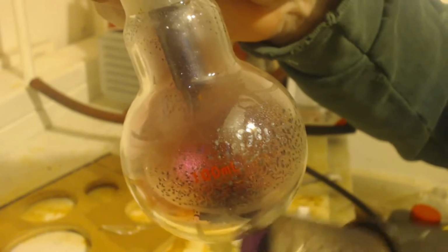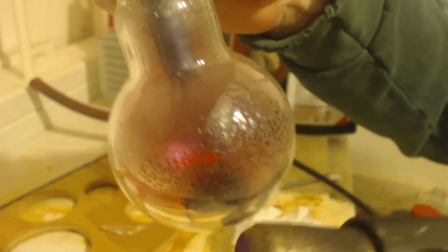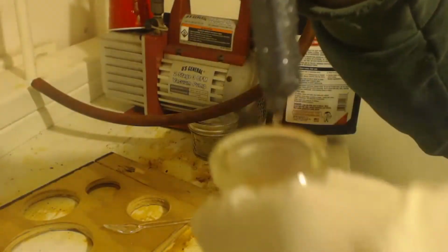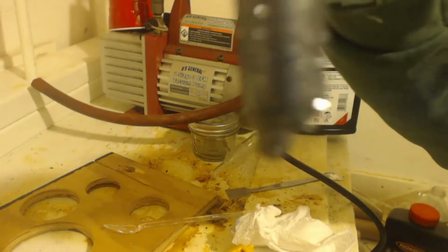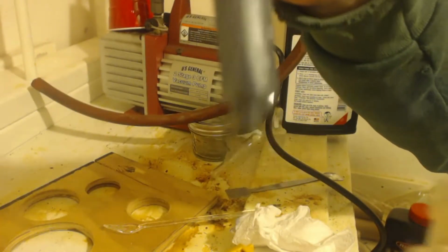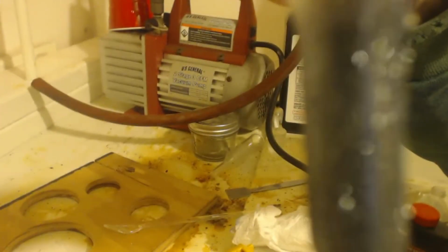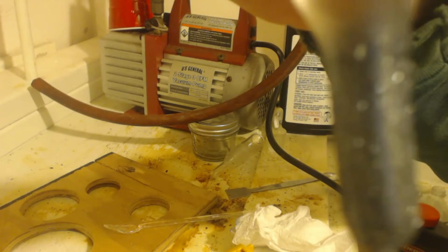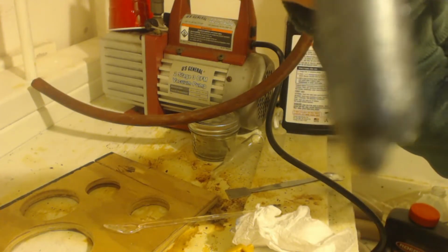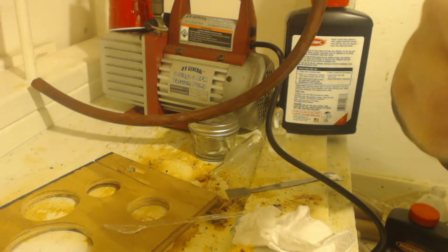Definitely should have dried this flask first, heated it up so I got all the water out of there. But you live and you learn. See how it's getting a drop of water at the bottom. You can see how you got all that. Look at that. It's all sparkly. It's all pure. I could just take a little grain off and throw it into the whatever. I'm just going to store this like this.